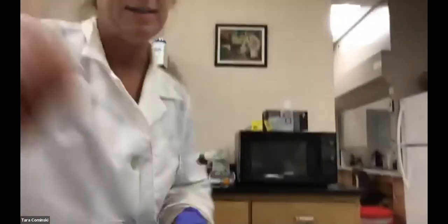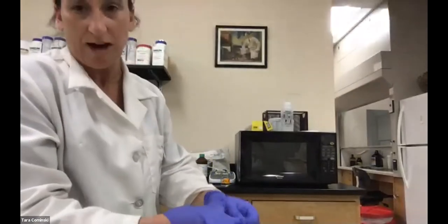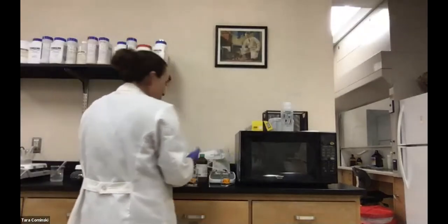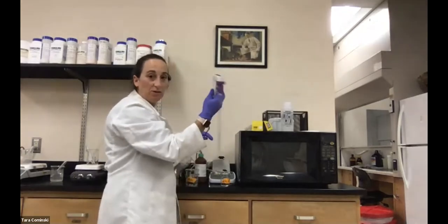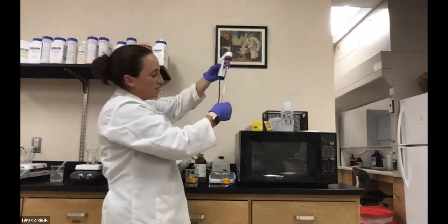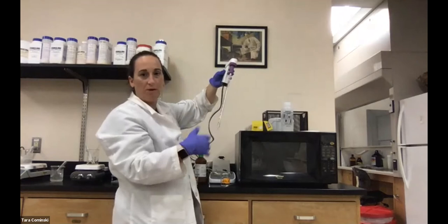So as I was saying, I'm gonna be using some serological pipettes just to do some of the measurements. I think I showed it to you guys in that first lab, but it's just another way of measuring volumes, particularly with this serological pipette. With this, the actual max volume that you can measure is 10 milliliters. So I'll use it to do 1 milliliter, 4 milliliters.